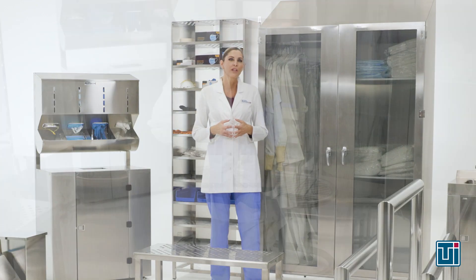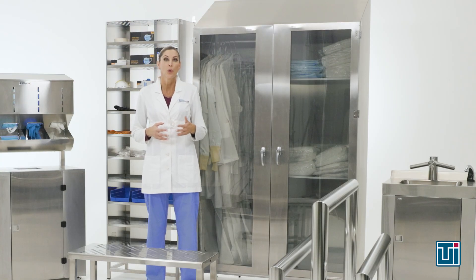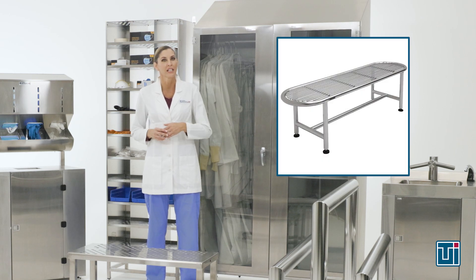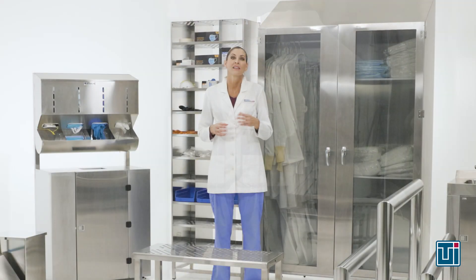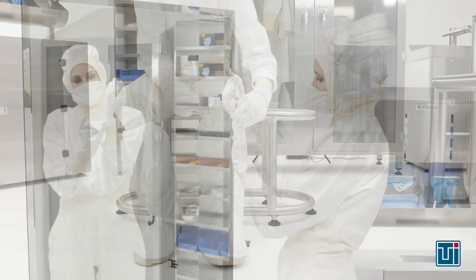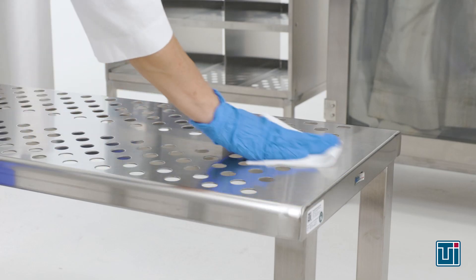Next, you can use a clean gowning bench or lean rail for support as you put on your coverall. Terra's gowning benches feature corner-free construction with tube tops to minimize particle accumulation and simplify cleaning. Make sure your coveralls don't touch the floor and that your hood is tucked inside the coverall. Lastly, you'll put on your clean room booties. Note that both booties and gloves should overlap the coverall.